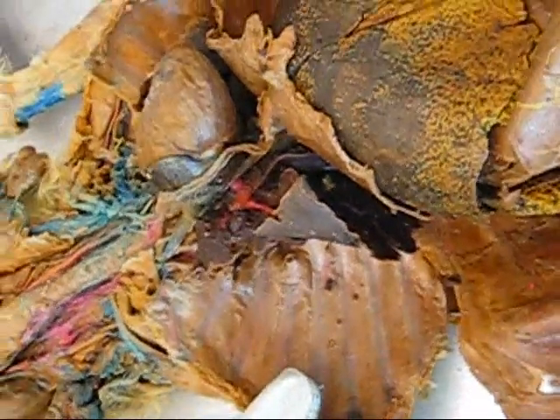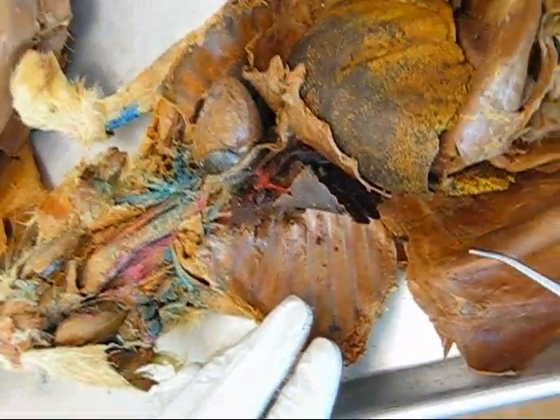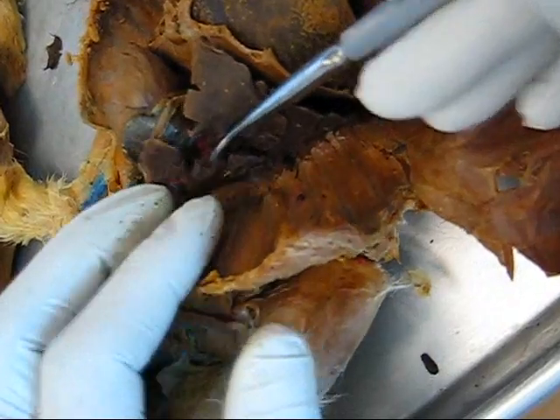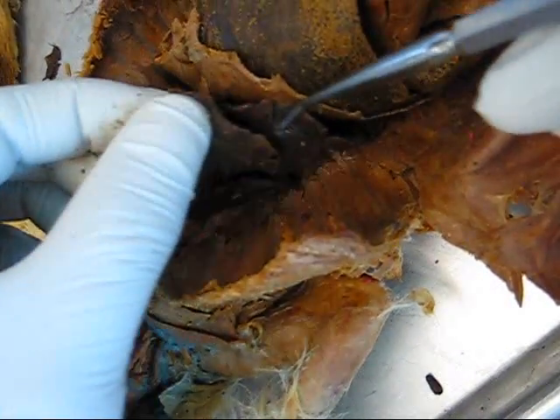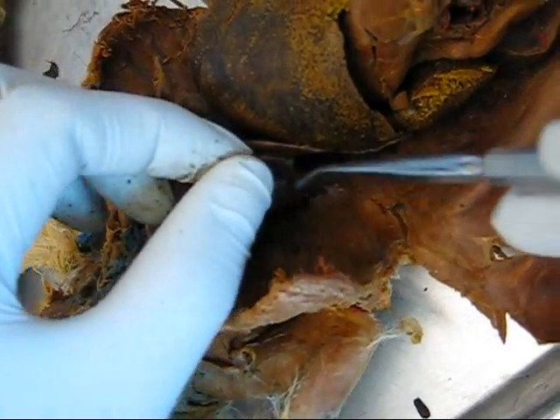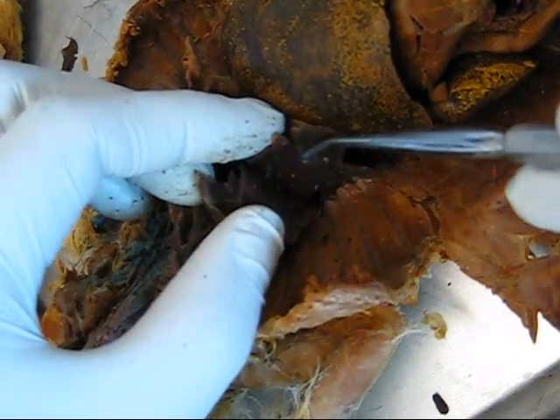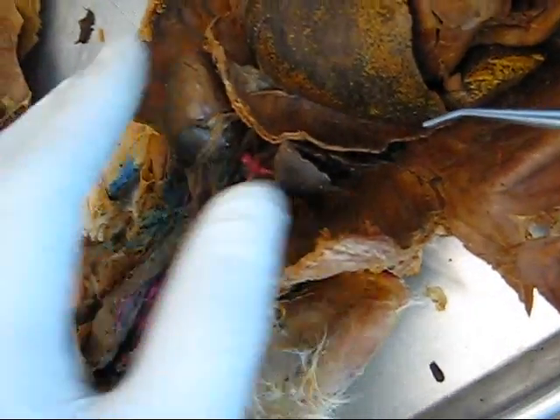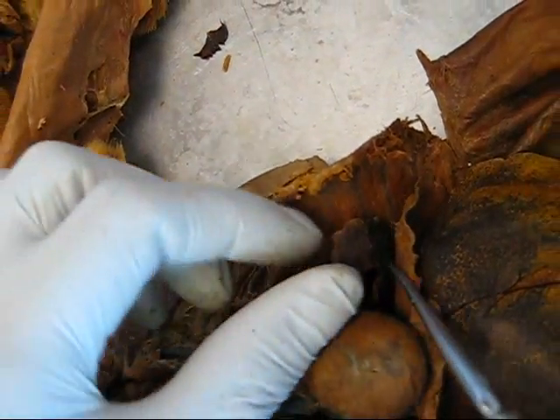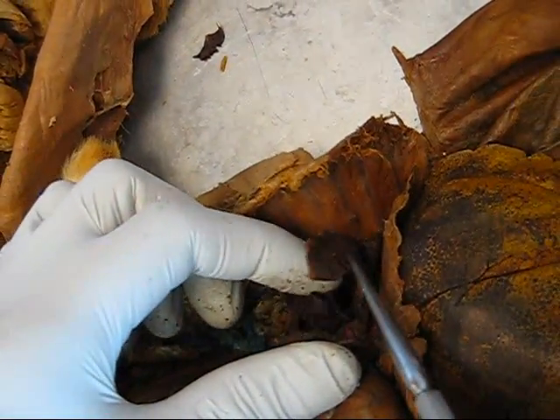Right lung: lobe one, lobe two, lobe three. Left lung: lobe one, lobe two.